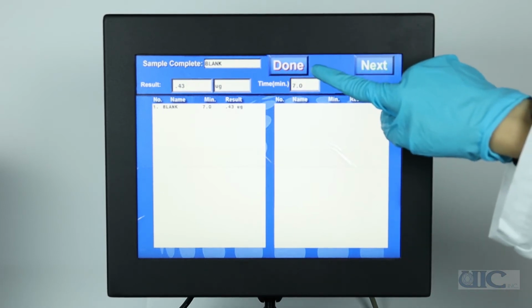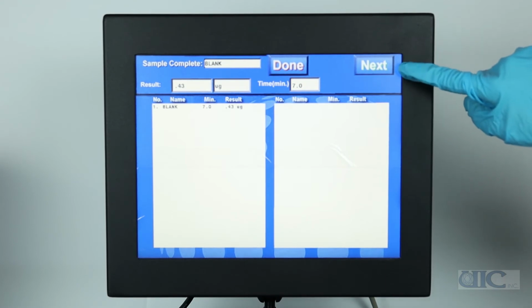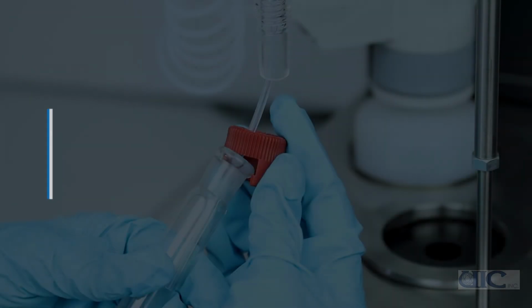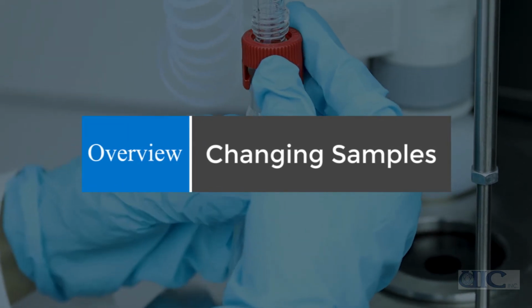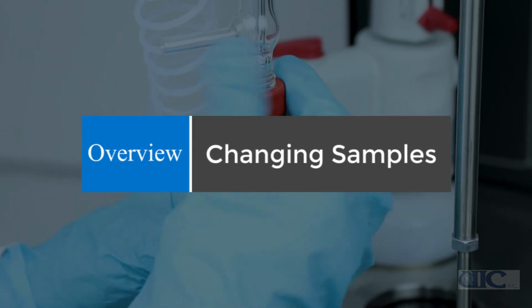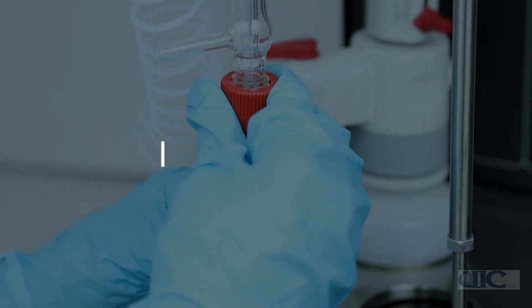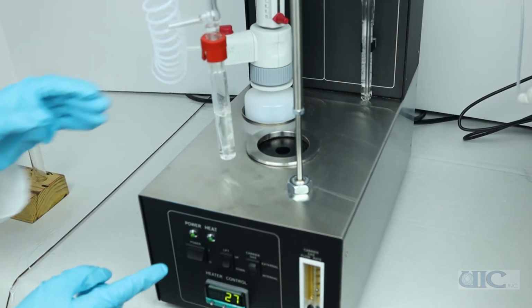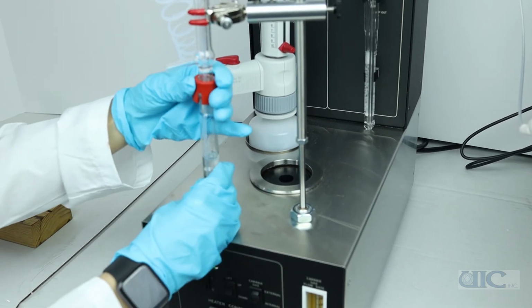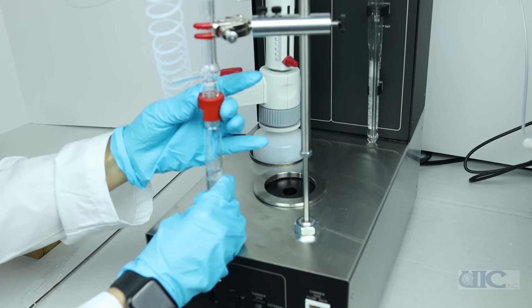If you are finished, press Done. If you would like to measure more samples, press Next. To change samples once the blank is finished, press Lift Up, unscrew the red joint connector, and slowly pull the flask down.